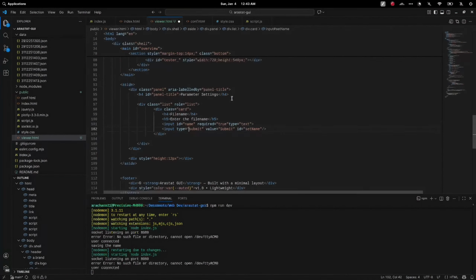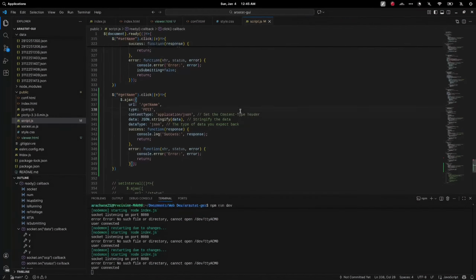We made the web app for both front-end and back-end. We used Node.js and Express.js for our back-end. The back-end routes our requests and communicates with the microcontroller through the serial port, as we used the UART protocol. The front end, on the other hand, provides us a dashboard and parameters for our devices. This way, we don't have to remember all of the assigned command numbers. Just fill in the parameters, then submit, and we communicate with our devices.